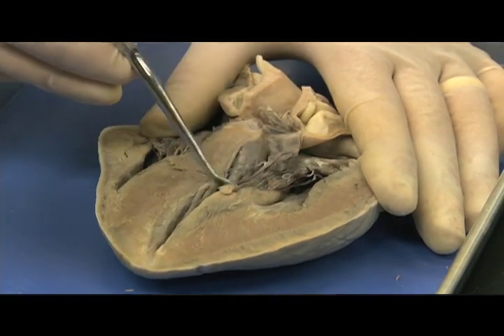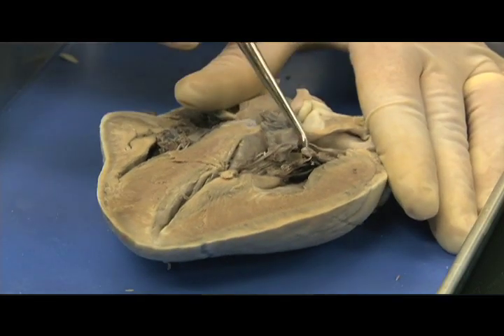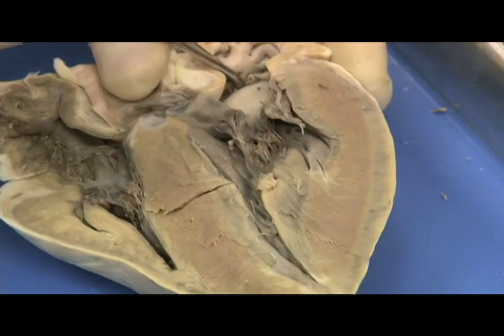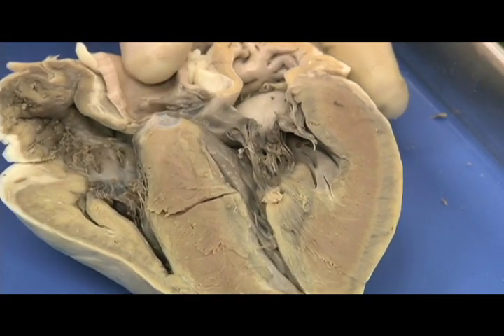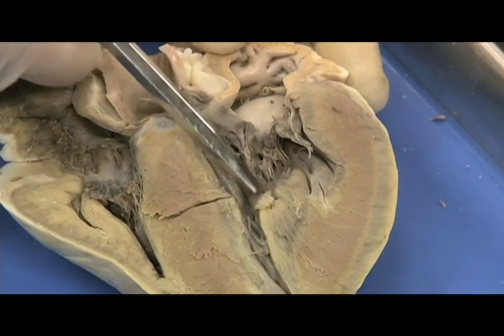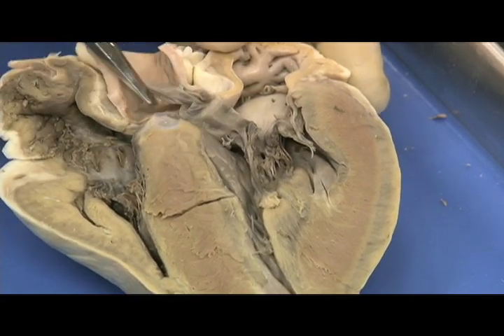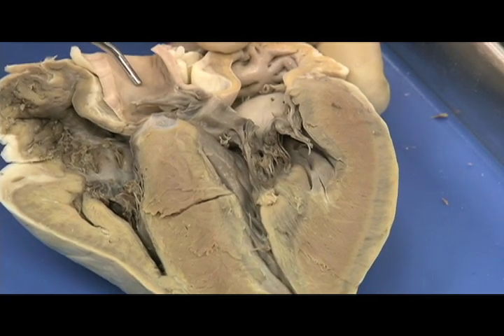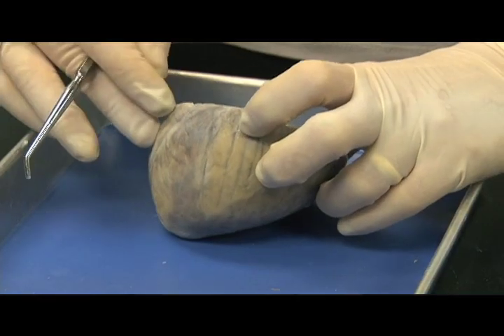This is the bicuspid valve. Inferior to the bicuspid valve is the left ventricle; superior to the bicuspid valve is the left atria. In this cut we have a nice view through the aorta, demonstrating how blood will exit from the left ventricle into the aorta — notice the remnant of the aortic semilunar valve.